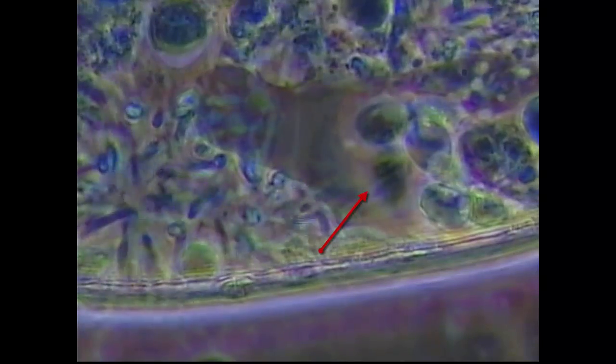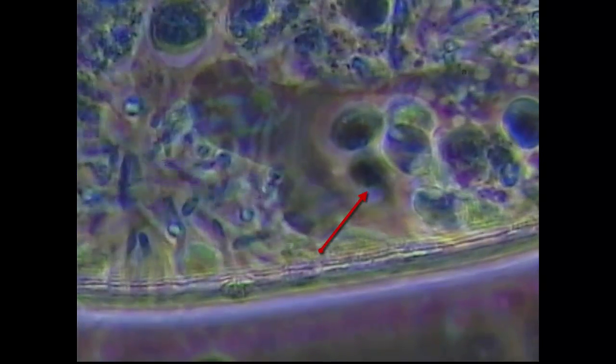As the food vacuole moves around, you're starting to see the spirochete wiggle around, and I think what occurred is this amoeba is absolutely full of dead PMN cells. That's what these Entamoeba gingivalis like to eat. And I think the spirochete was probably inside one of the white blood cells that got engulfed by the amoeba. And you see him kind of, well, he's trapped.